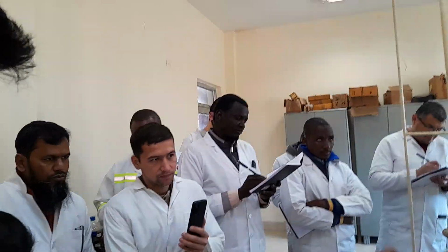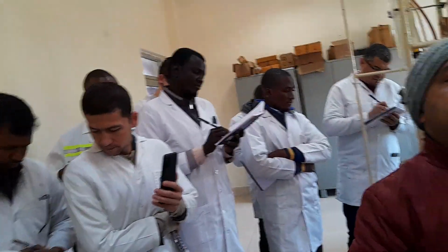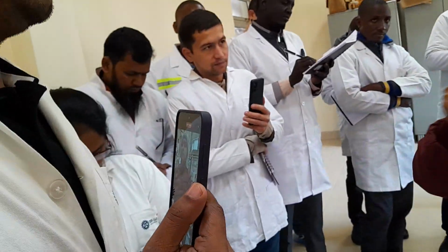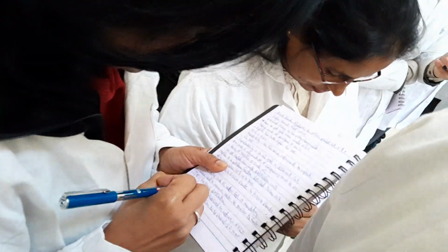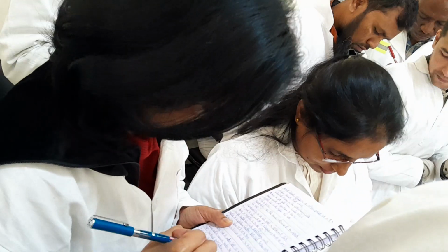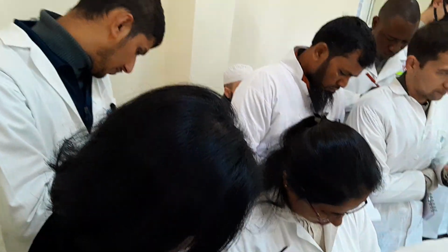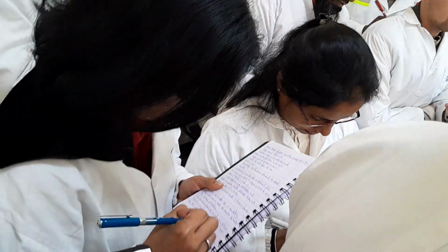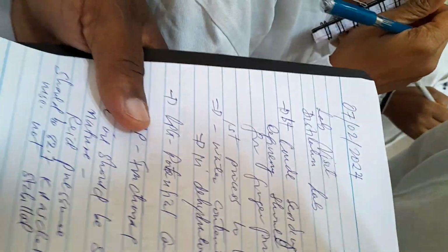If it is more than 82.7 kilopascal, then that crude oil is not in stabilized condition. Got my point? It should not be less than, it should not be more than 82.7 kPa for stabilized crude.